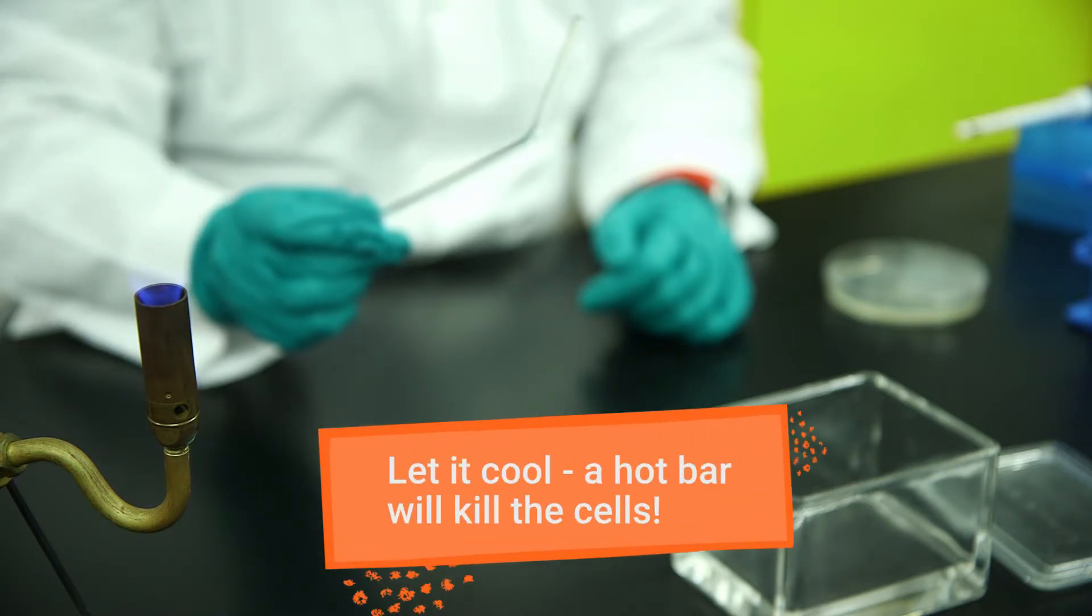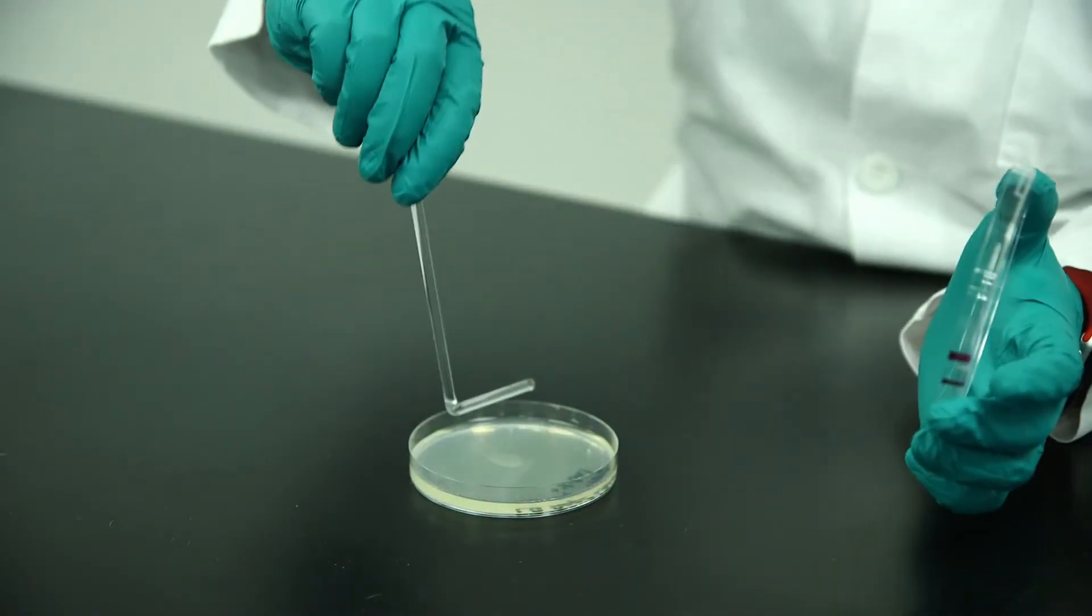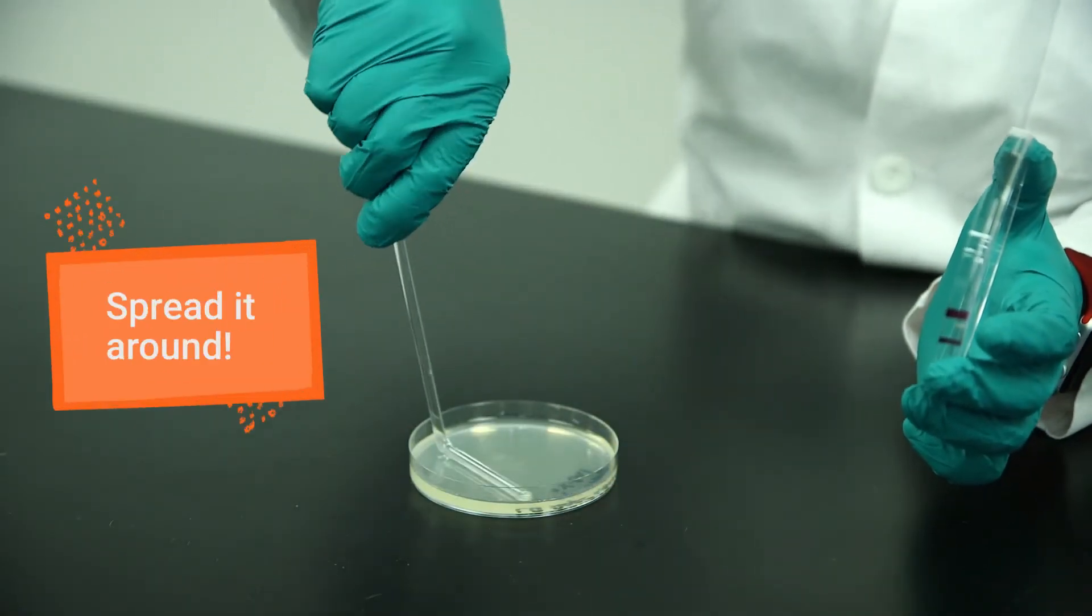Let the metal cool for a few seconds so you don't accidentally kill your cells, and then use the bar to lightly spread the cells across the plate.